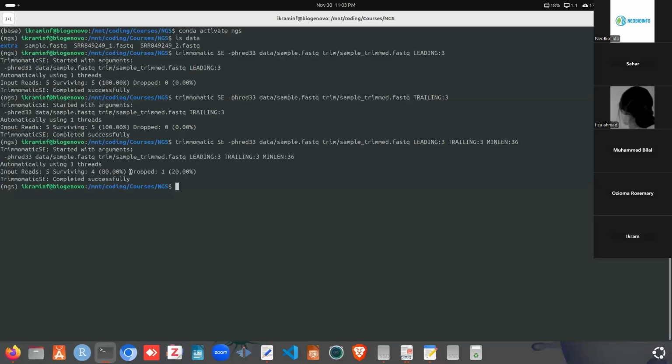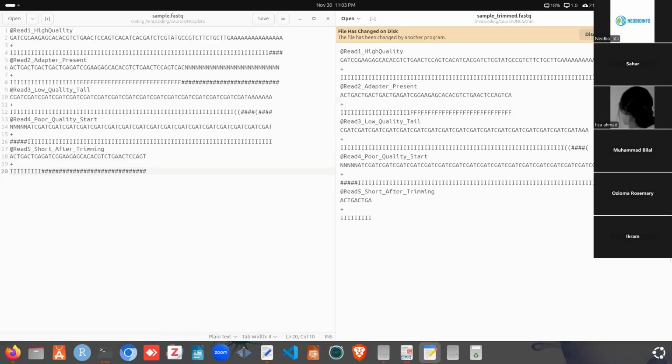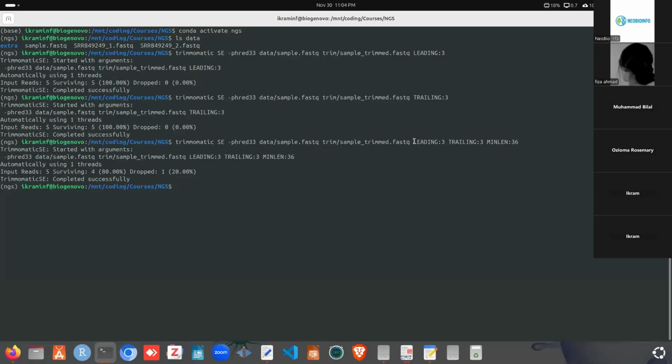So Trimmomatic dropped one read. We can check which read was dropped. Read 5 has been dropped after the trimming, as it has length 9, which is less than 36. So are these three parameters, leading, trailing, and min length, clear? Any question on these three? Okay, Isaac, you can tell me where the problem actually is.